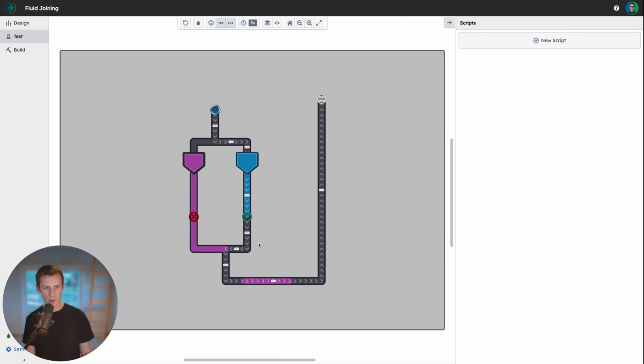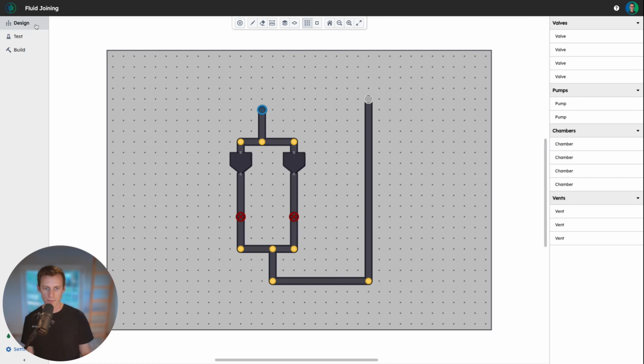We see a big gap of air between the fluid slugs from the length of the channel between the outlet of the second fluid source and the intersection between the two fluid sources. We will always need to handle the trapped air gap here no matter how close we move the fluid source to the intersection. This is when we can use a hydrophobic vent.